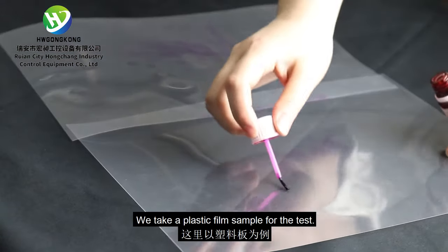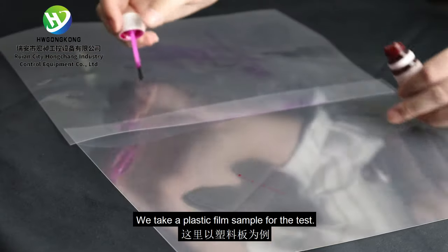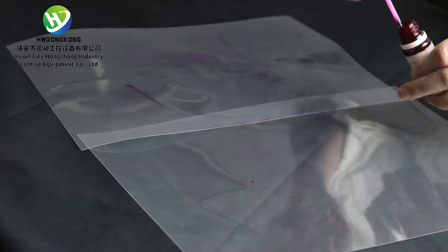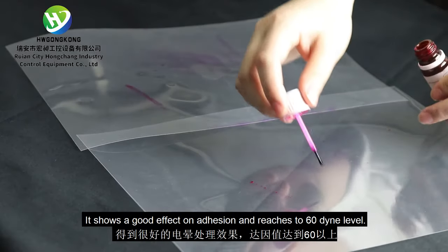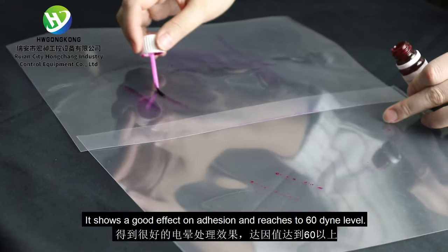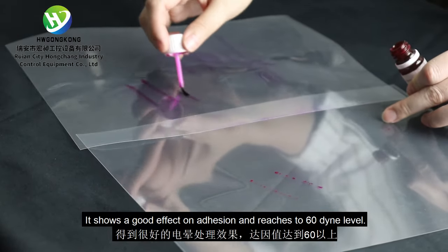We take a plastic film sample for the test. It shows a good effect on adhesion and reaches to 60 dyne level.